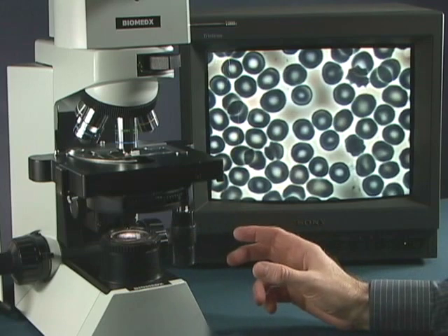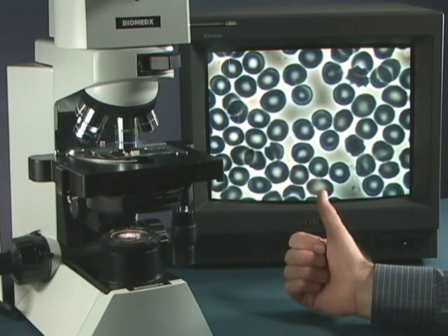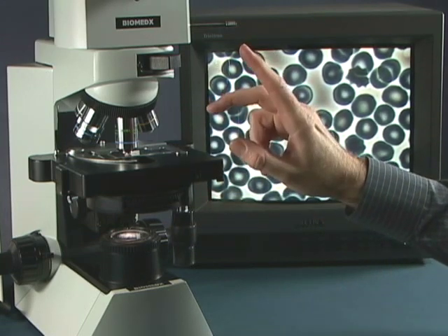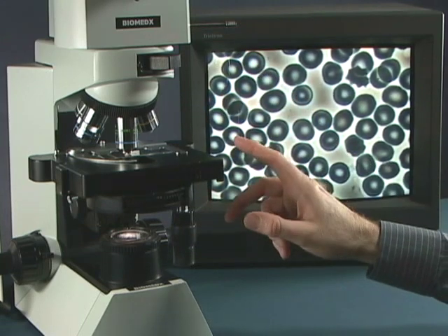Use either your centering telescope, do the eyeball method, or do the quick technician technique of putting the piece of paper on the stage, pulling out the eyepiece, and centering.